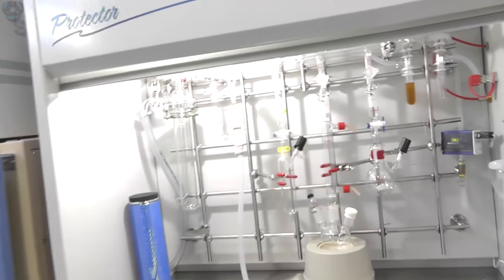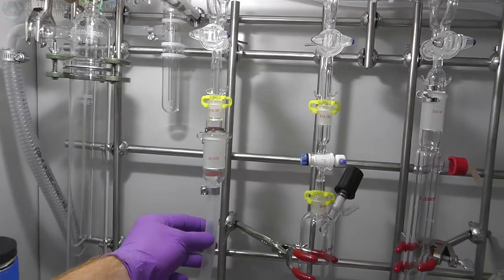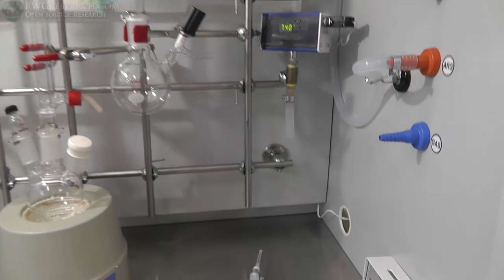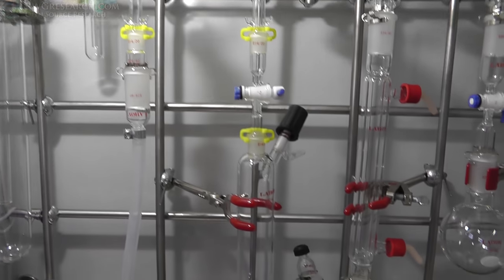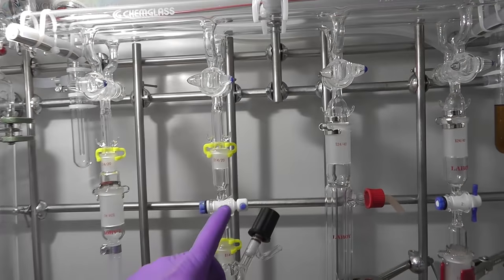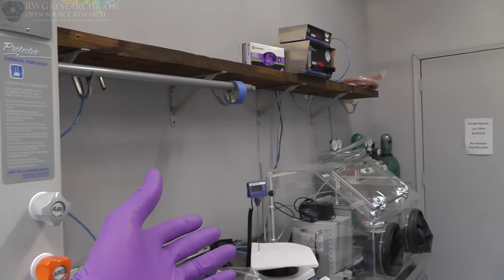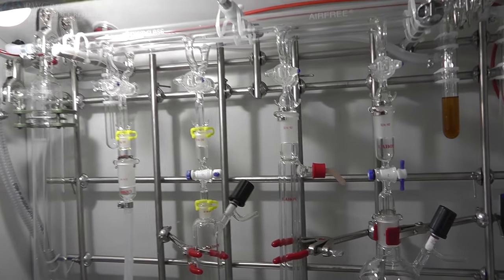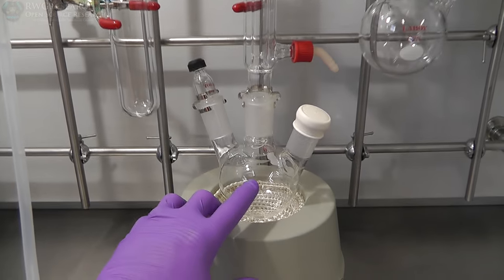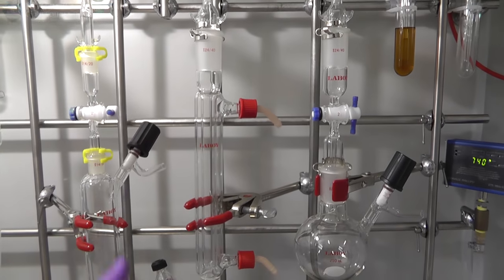Well, for all intents and purposes, I'm going to demonstrate possibly what a current setup could be. So here I'm just using this one as an extra gas port for a line that goes down to a syringe. Here I've got a long flask, reaction flask. Maybe I want to just do a storage in this one or something. I also put a valve here in case you wanted to take it apart here and keep it in an inert condition. Maybe you're going to put it in a glove box and open it there. There we just extended this one with a condenser. Obviously you'd hook up water here if you were going to actually condense something.